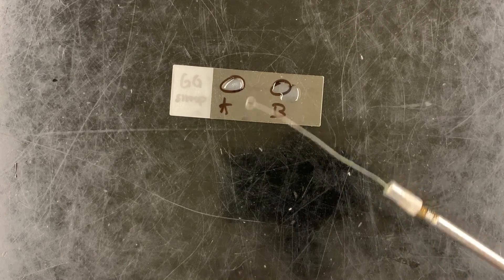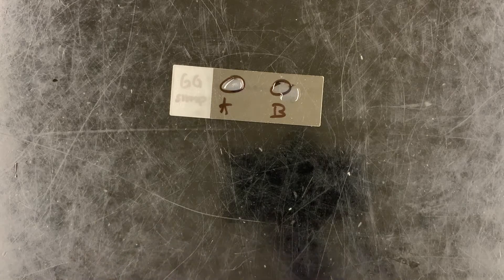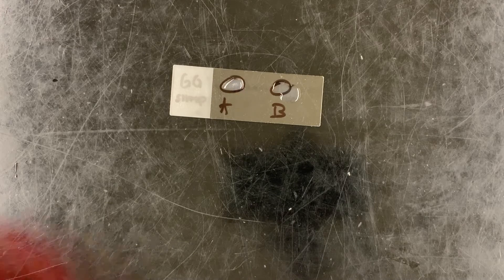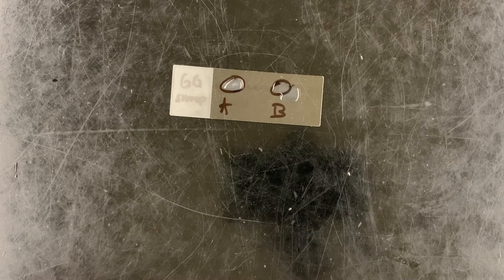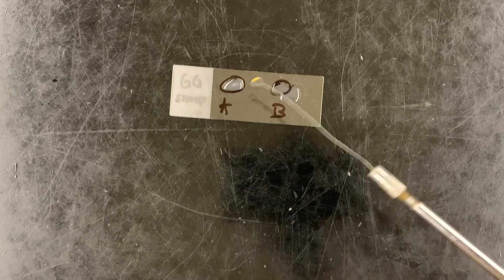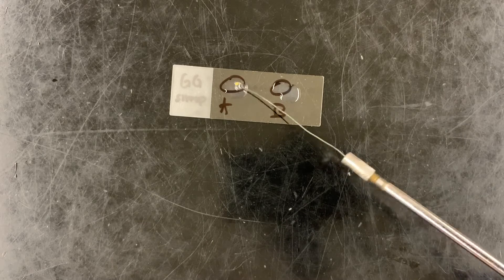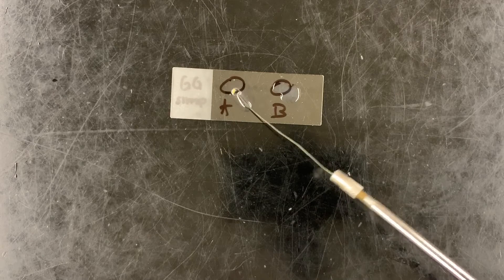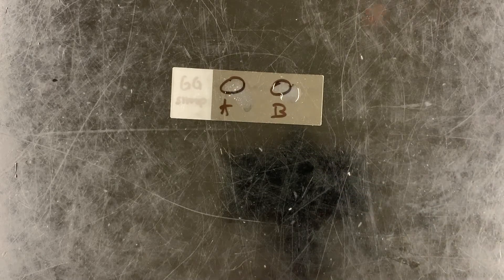Notice the plasma is kind of cloudy — that's how it's going to look. I'm going to add my test bacteria to circle A and then to circle B. Using the results, you can determine which one is Staphylococcus aureus and which one is not. Simply add it, give it a little mix, make sure the bacteria come out, and then let that sit for a bit.